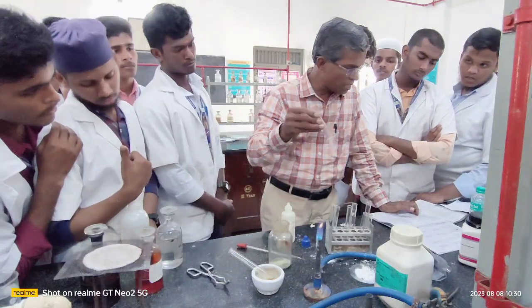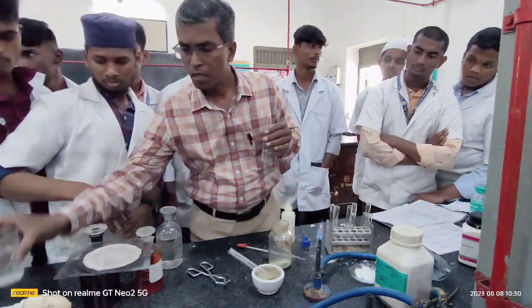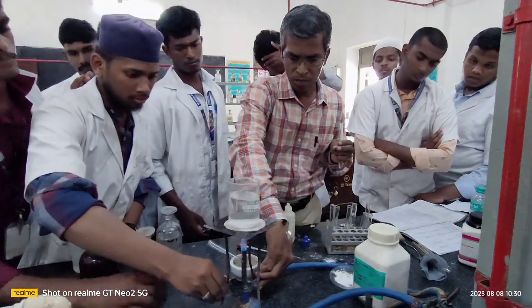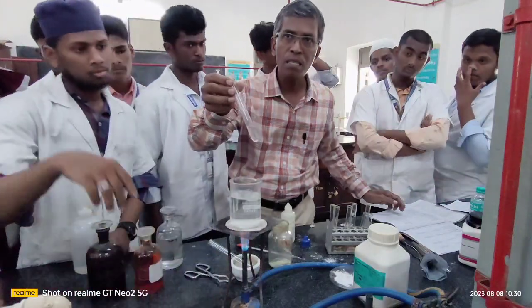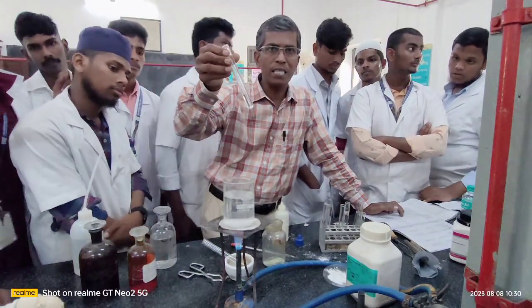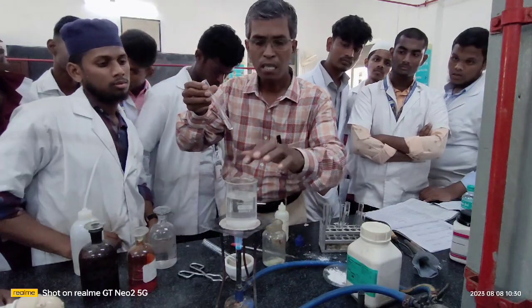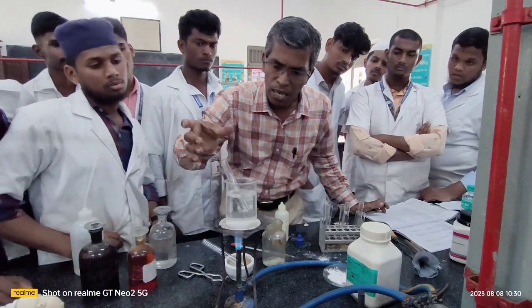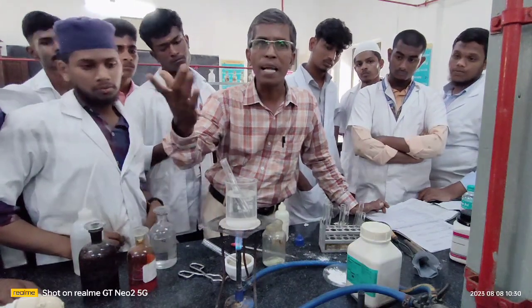I am heating this gently. Where is the water bath? Heat this entire mixture over your water bath. Allow the water to heat first, then you place the mixture containing the organic compound plus the Tollens reagent. I have heated this water to some extent. The water is a little hot. Now I am placing this in the water bath and allow the water to heat completely.